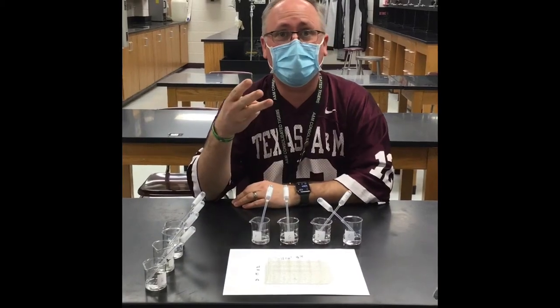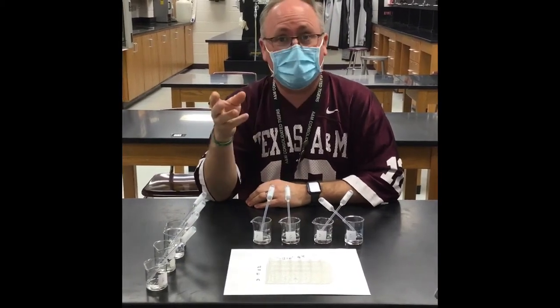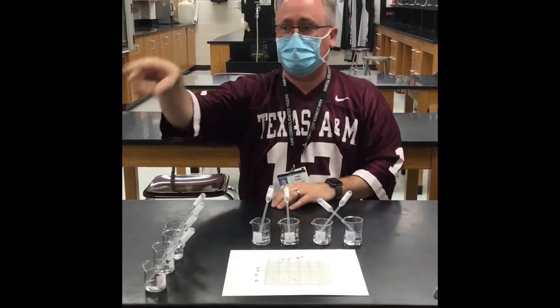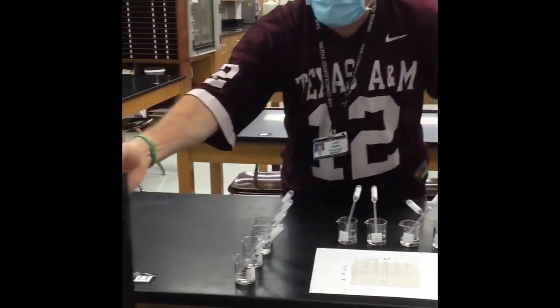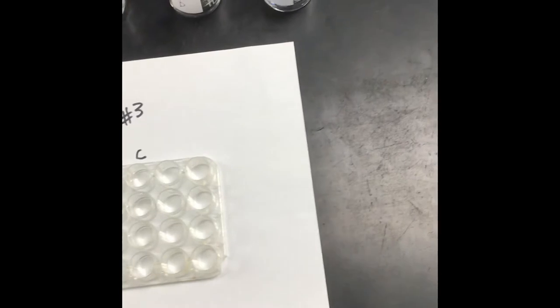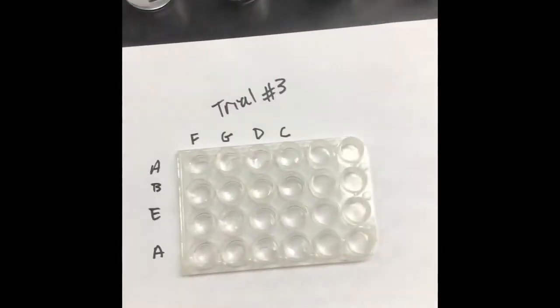Okay, so this is the third of the different trials that we're doing for our bonus lab. So what I have done here, we're going to get you guys set up right here. This is goofy, I know, but this is what we kind of have to do to get these things set up for you guys.